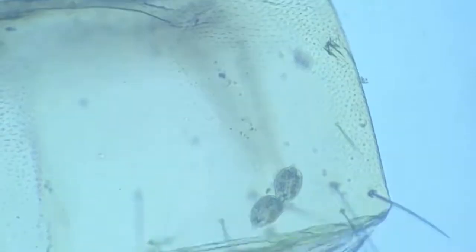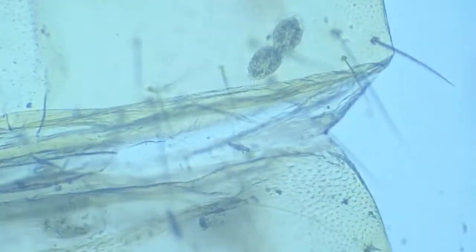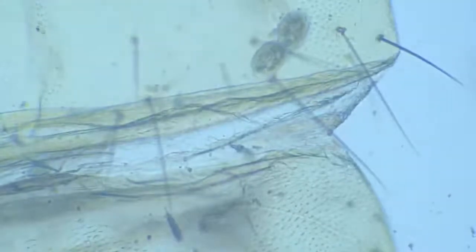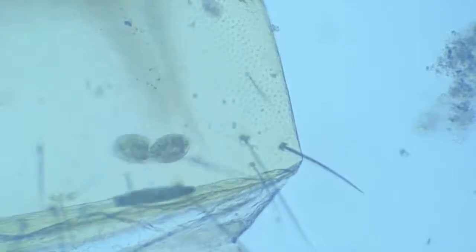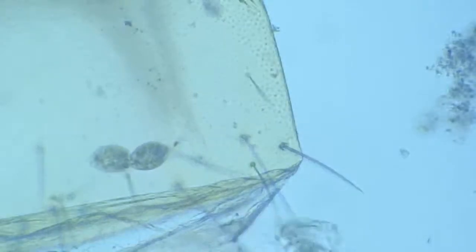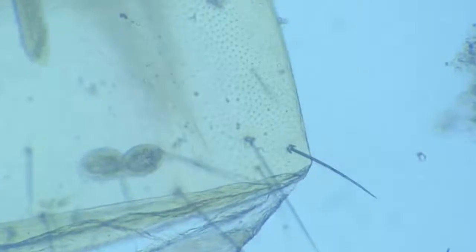I'll increase the light a bit. But before that, let me get them back in focus. Here they are. This light arrangement seems to be good. So here they are in the process of conjugation. It's a little tricky to get them under sharp focus because they are behind a curtain of cuticle wall.